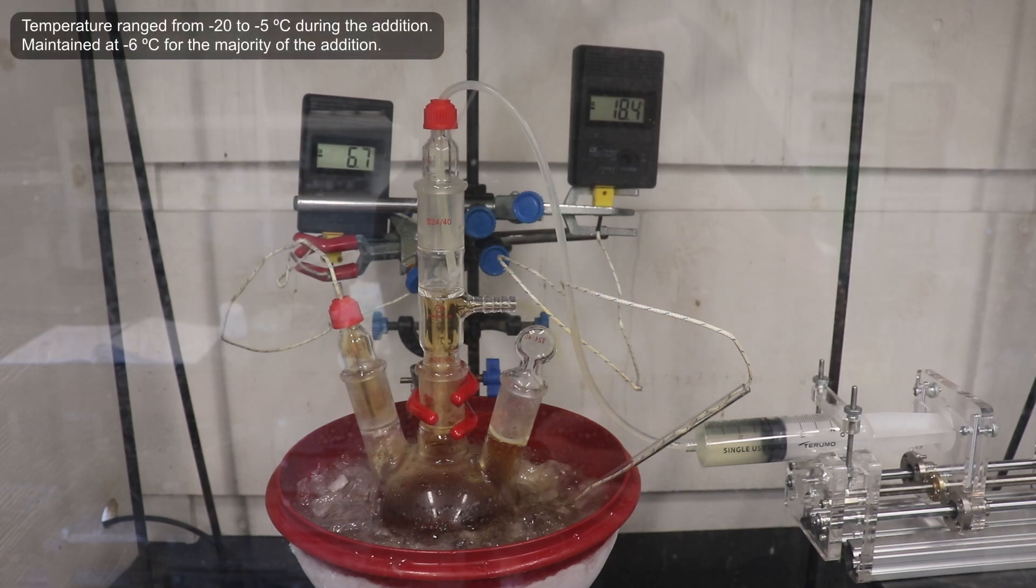About halfway through the addition, the internal temperature of the flask had risen to around negative 7 degrees Celsius, and over the course of the entire addition, the temperature never rose above negative 5 degrees Celsius.